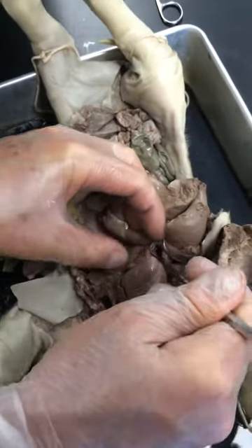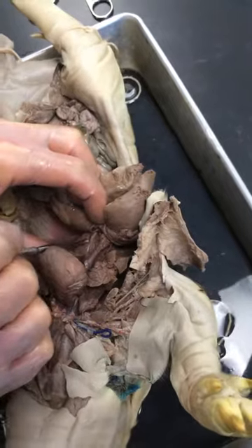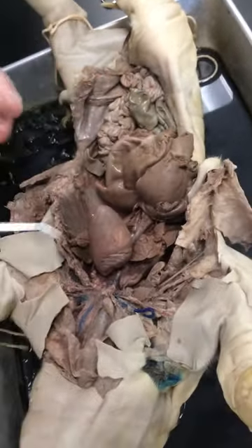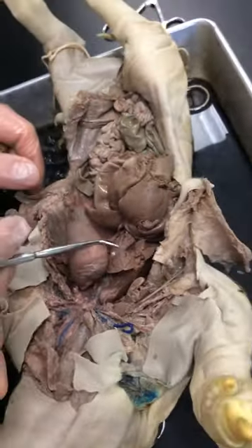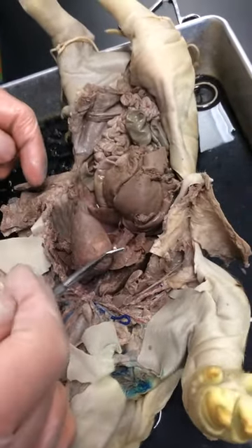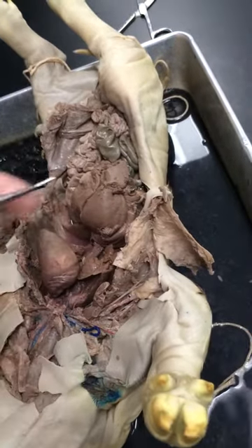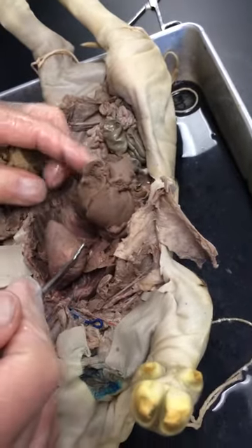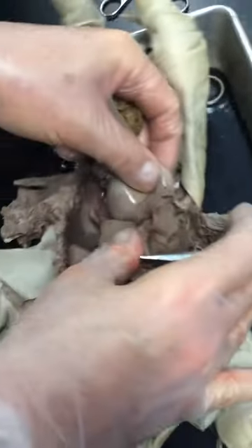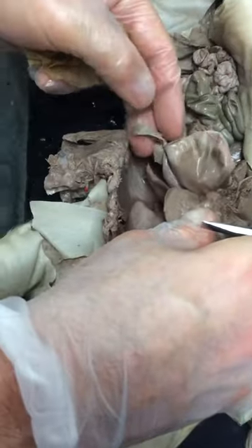The esophagus is this tube right here, right next to the inferior vena cava — between the inferior vena cava and the thoracic aorta, which are fairly obvious. The esophagus is not as obvious because it's collapsed. The stomach is this big sac right here in the abdominal pelvic cavity.